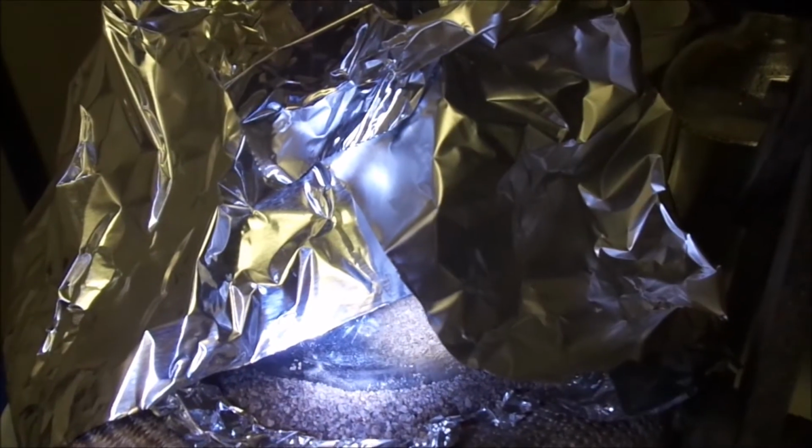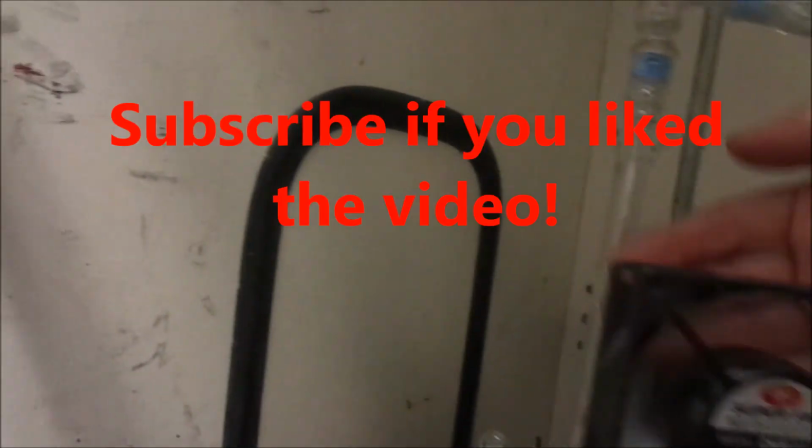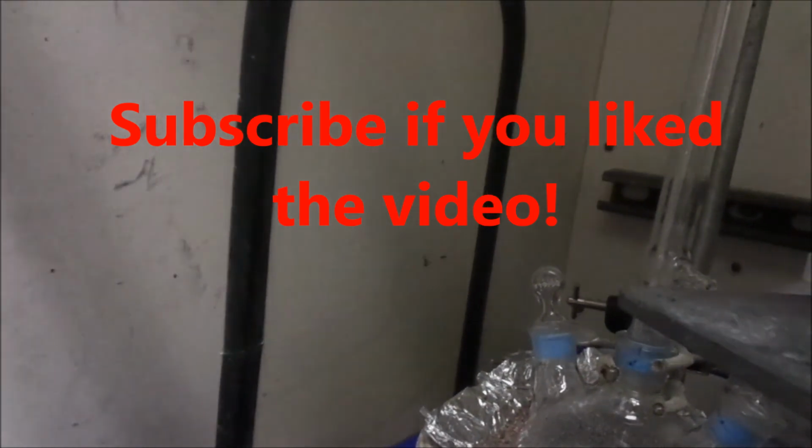So this is something that just happened near the end of the distillation. The mercury just starts spinning like crazy. If you have any idea why, post a comment, because I can't figure it out. So the fan, the air is actually blowing backwards. So let's put that on properly. There we go.